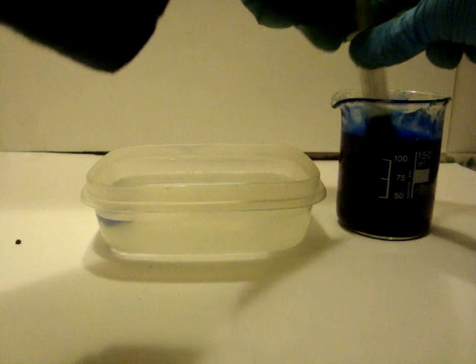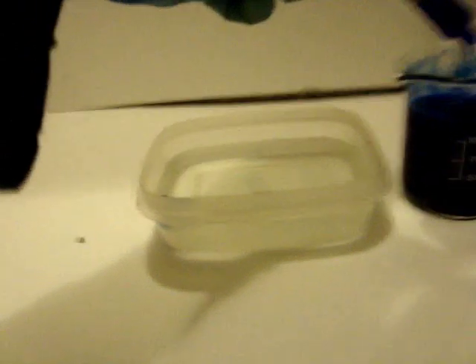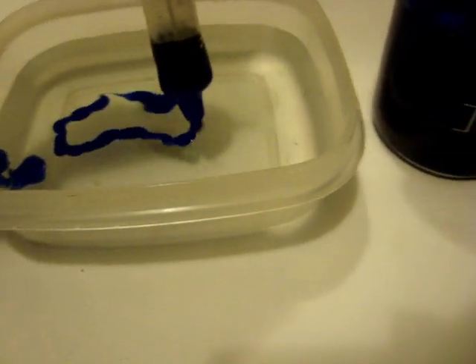Into a large container, put a solution of 5–10% sulfuric acid mixed with water. Then, with a syringe without a needle, take part of the jelly and extrude it to form wires upon the acid bath. Rayon forms instantly. If you want to get finer wires, put the needle on the syringe after you charge it, or it will block.